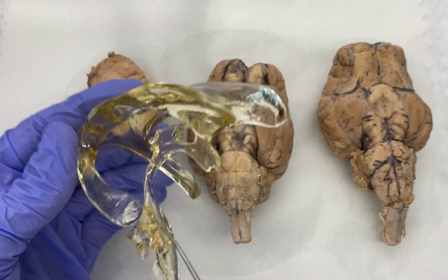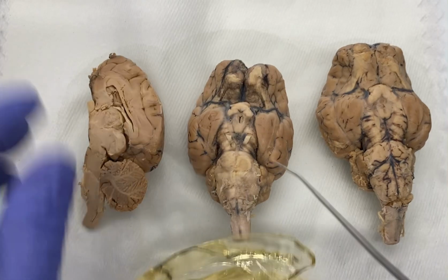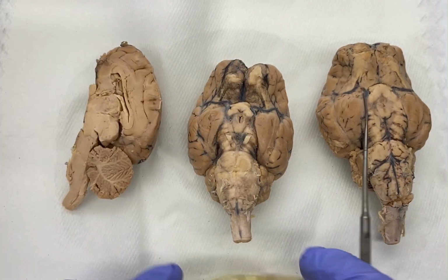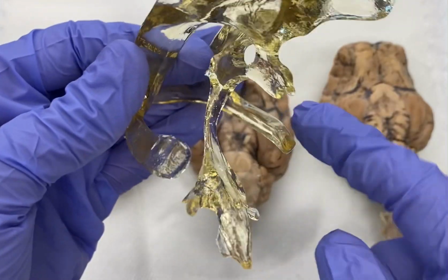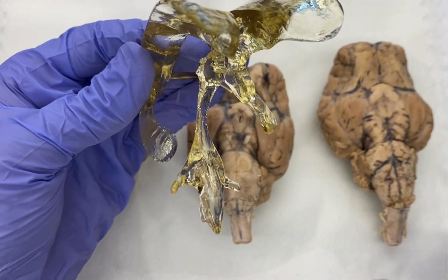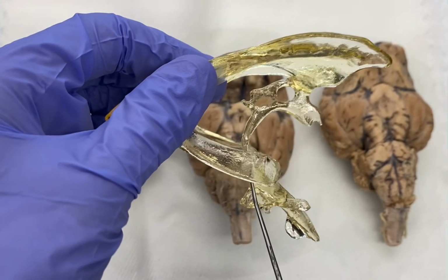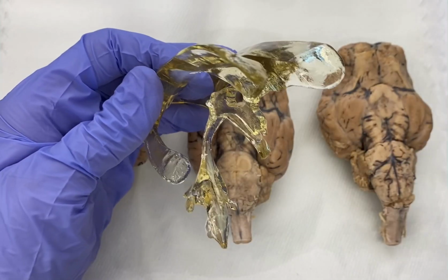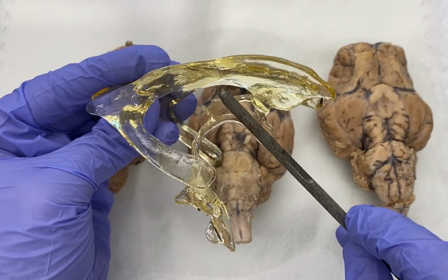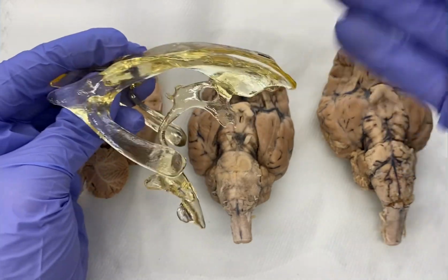From the third, we go down to our fourth, but we have to go through this long tube called the cerebral aqueduct. And this is our cerebral aqueduct, all right here. That tube extending down from our third all the way down into our fourth, that's the cerebral aqueduct, and that's what we see right here, this long tube. And then we go down to our fourth, and from the fourth, we said that there are apertures, and these apertures extend into the subarachnoid space, and you can see some of those apertures here. You can see these 2 lateral here, and then there'd be this medial here that extend out into the subarachnoid space. So again, as a review: lateral, interventricular foramen, third, cerebral aqueduct, fourth. That's the pathway, and then from there into the subarachnoid space.